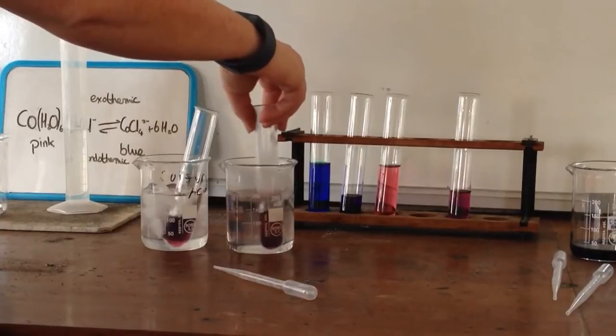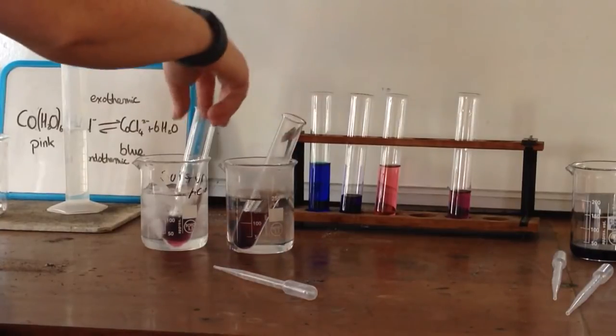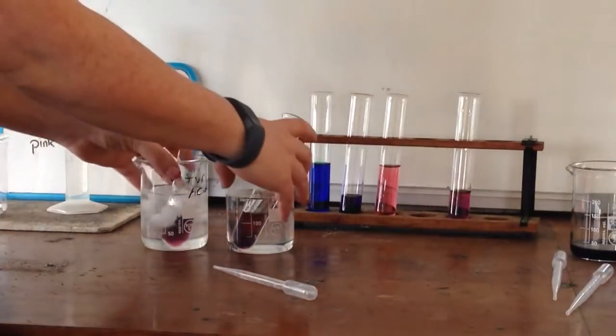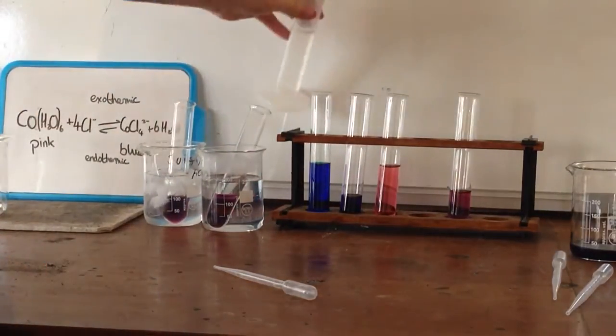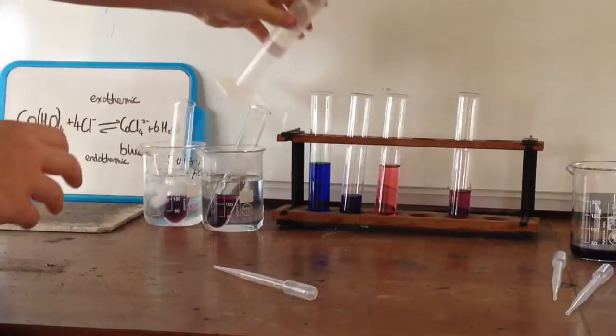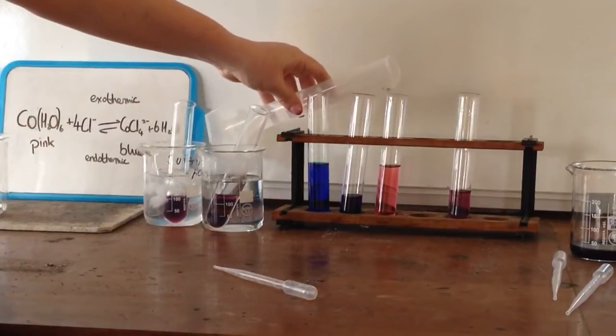So you can see this one is starting to go blue here and this one is starting to get pink. While that's going on, I'm just going to show you these ones reversing, so I'm just going to add some hydrochloric acid to this one here that has the water in.